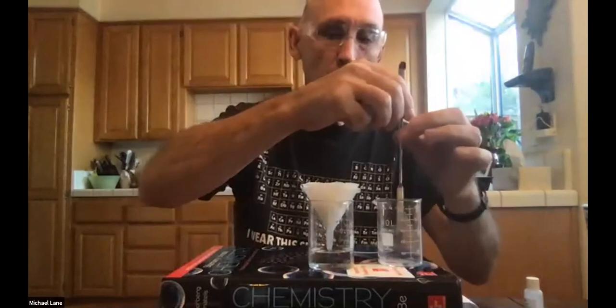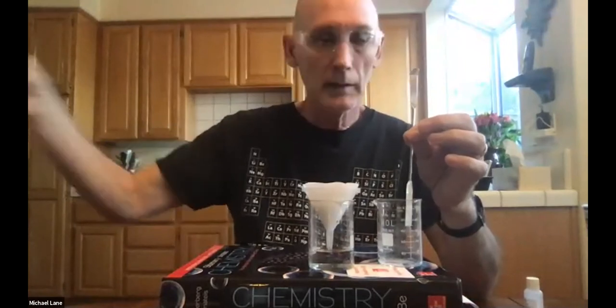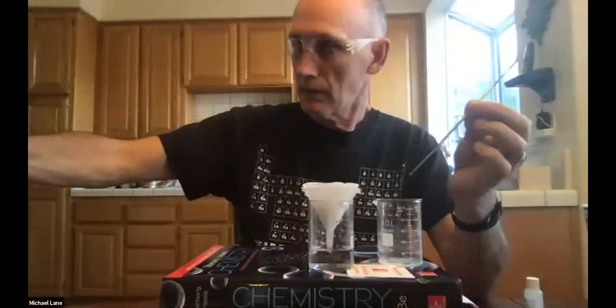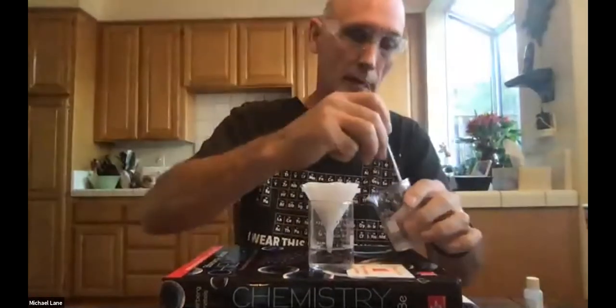Now, again, you perhaps can see that this is a little bit cloudy. That's because there's some calcium carbonate in there and we want to get that out. I'm going to rinse off my spatula and, there we go, a little bit more. And stir that up.